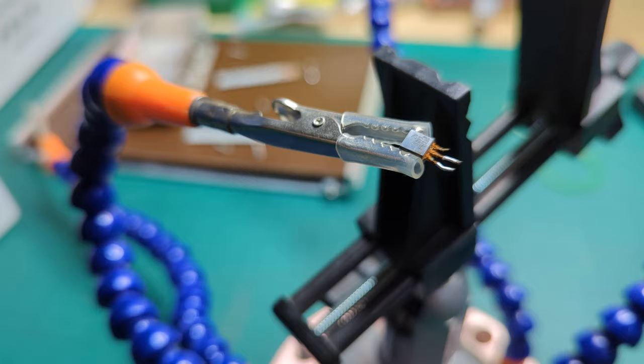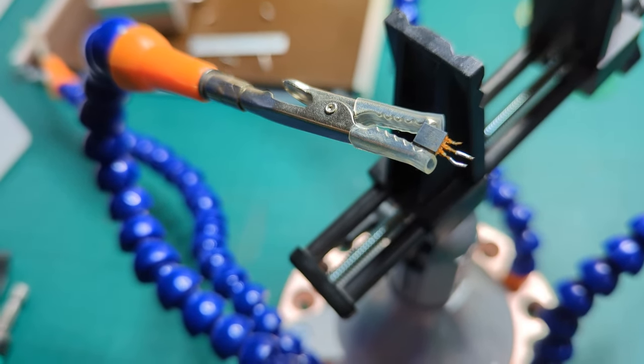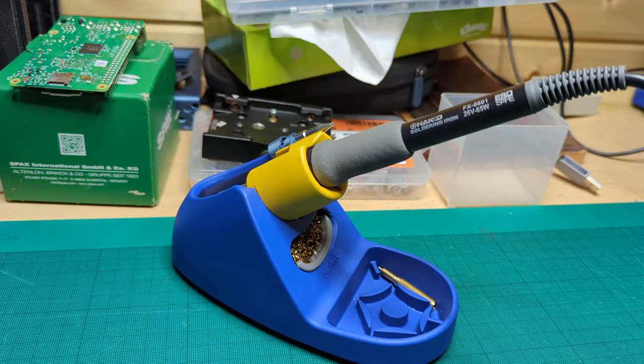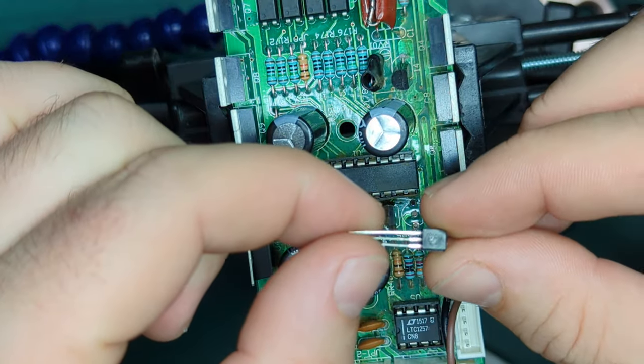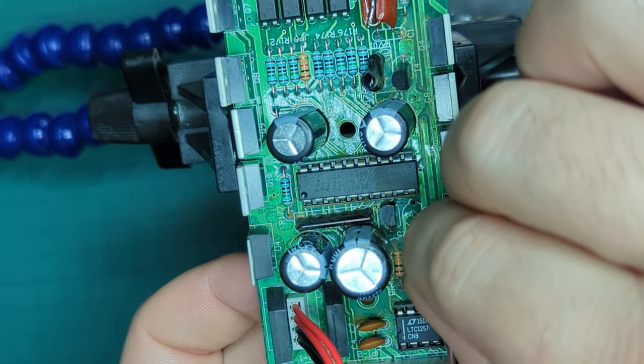Now I've taken it out, you can see just how badly corroded that part is. Luckily, it is a transistor, and I could see that it's part of the kit that I've got at the top there. I just got this from Amazon. It's got a couple of hundred different transistors of different types, and this one was part of the kit.